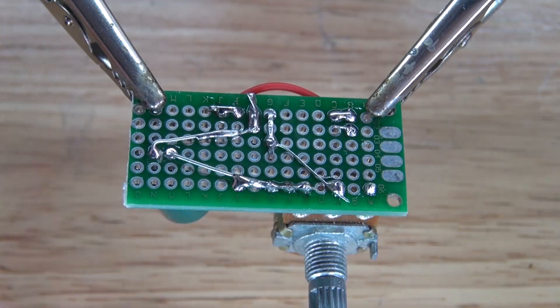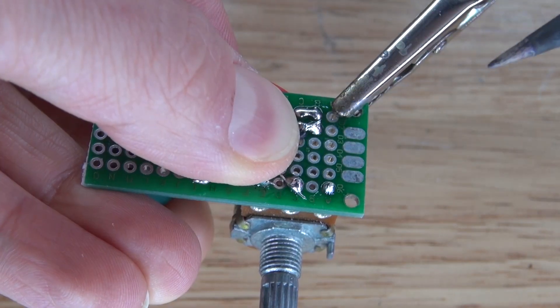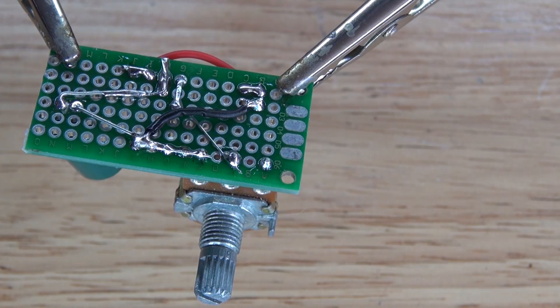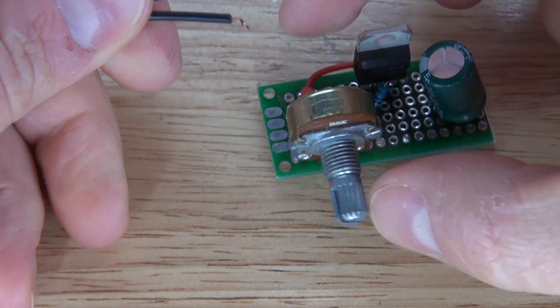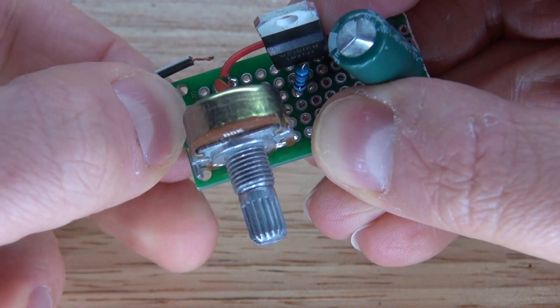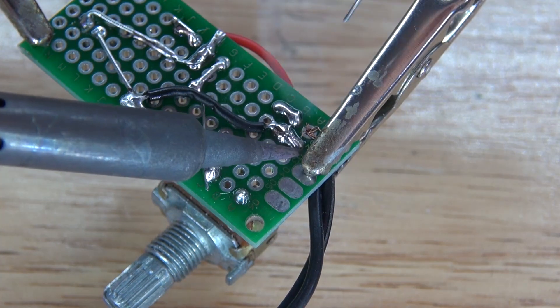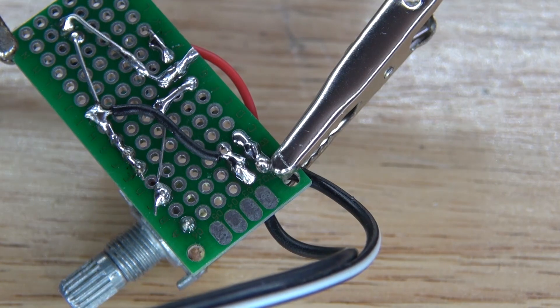Next I'm going to take this negative bridge wire and create the common ground. I'm going to solder the negative of the ceramic capacitor to the negative of the electrolytic capacitor, and the negative of the potentiometer — the common ground is now connected. Next I'm going to take the stripped wires from the 12 volt power supply and solder those to the ceramic capacitor: the positive side and the negative side. That will be my power source for the input — solder bridge it together. The input is now created.